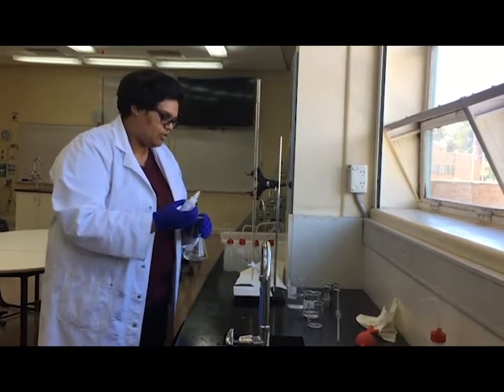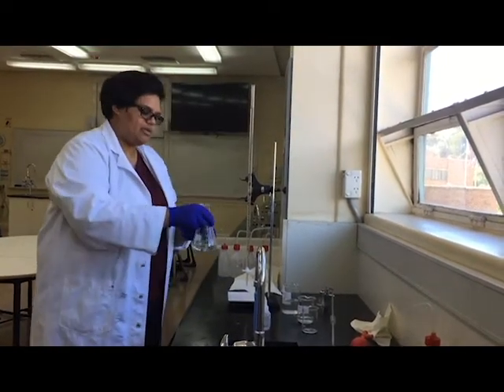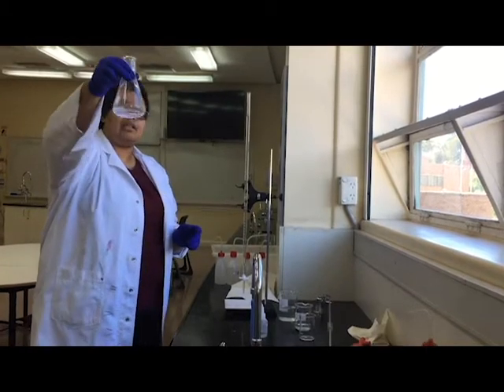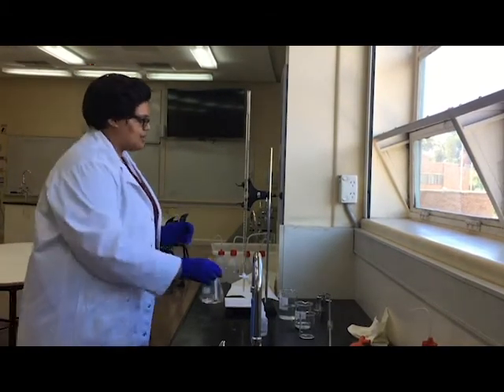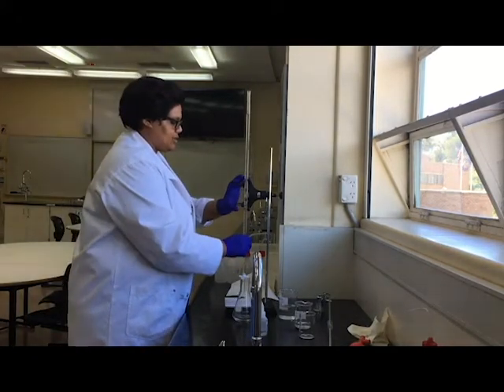One, two, or about three. Give it a bit of a swirl. It's nice and colorless. That's a good sign. It means that I'm in acidic conditions rather than basic conditions. And so now I'm ready to start my titration.